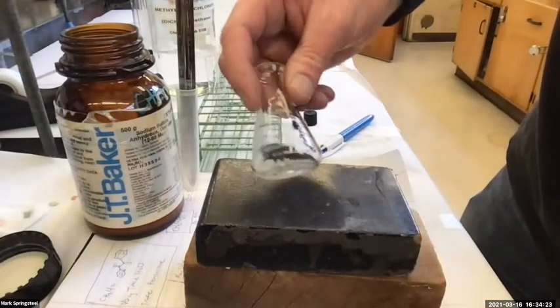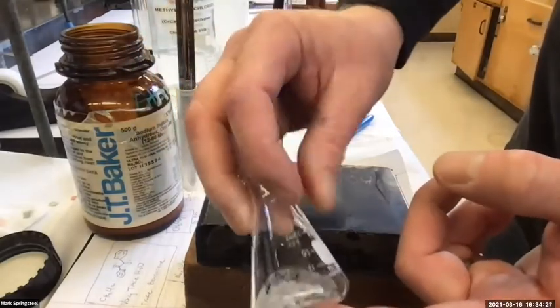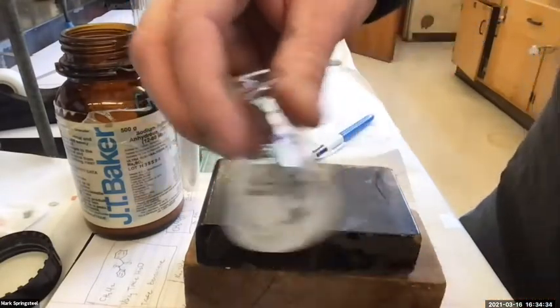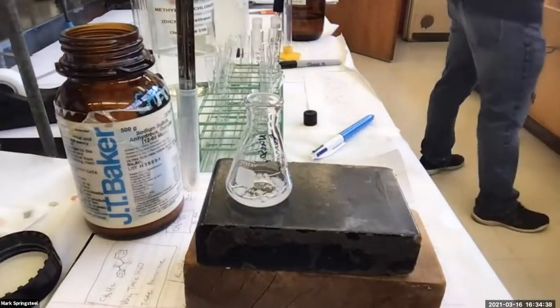All right, yeah, I see some grains that are not clumps, some small ones as I move it around. And the solution on my end is much clearer, and I'm not seeing a lot of drops of water on the inside of the glass. So I think I did it good. Now I just need a beaker. Let this evaporate too.